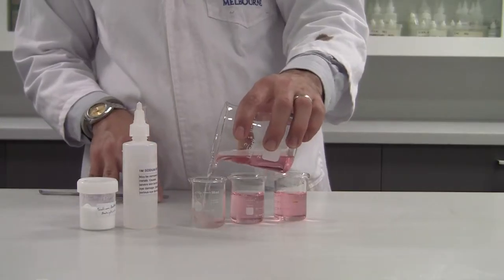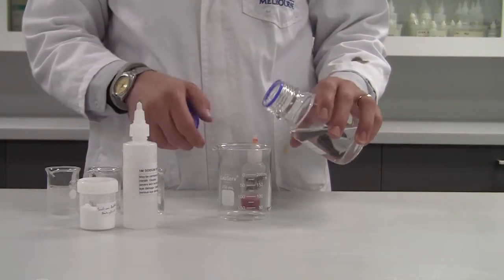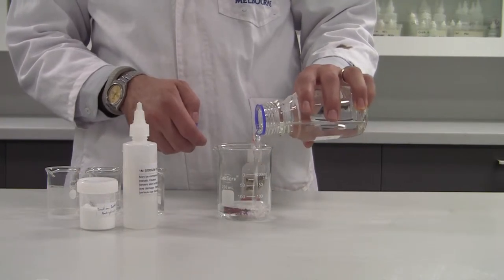Acetic acid, or ethanoic acid, is your go-to weak acid when talking about what a weak acid is and the role of weak acids. This is a great one to show students thinking about equilibrium — predicting, observing, and explaining changes. We've got two separate beakers, both containing an equilibrium mixture of acetic acid, its conjugate base acetate, as well as hydronium ions or H+ ions.